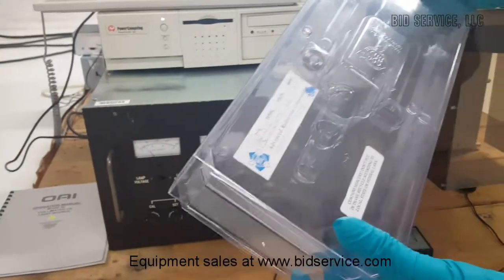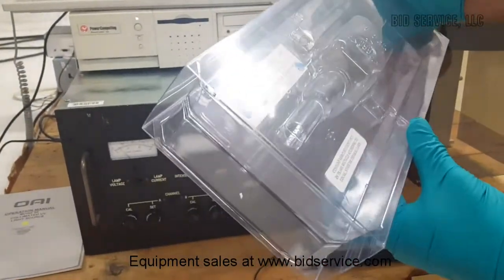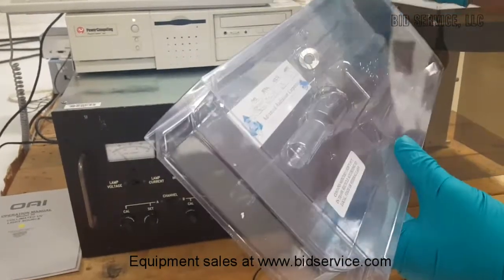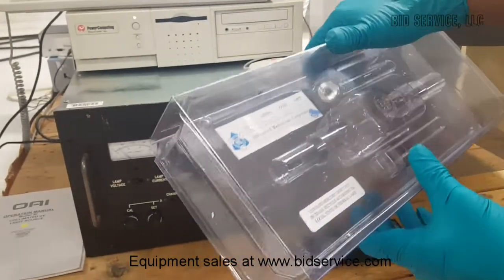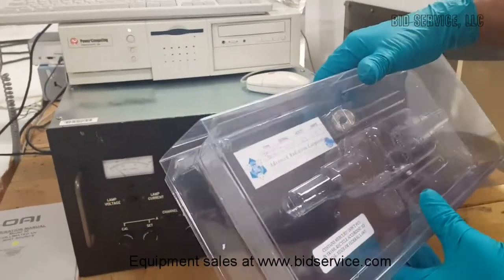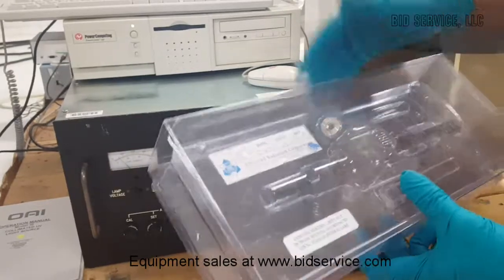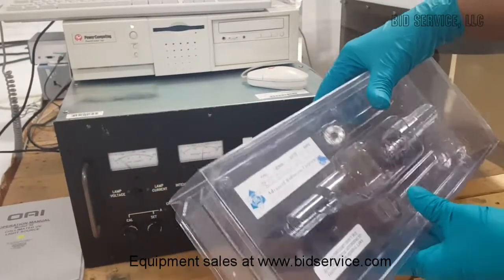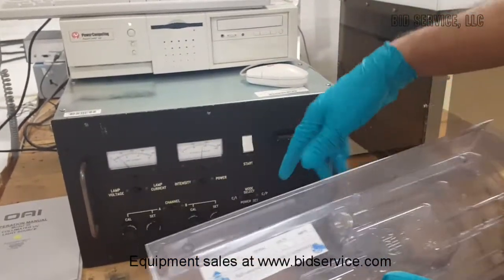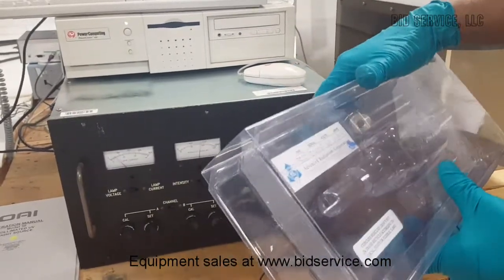This lamp has a limited life in hours as per the manufacturer, and once after usage, if the intensity levels seem to be dropping, then the lamp needs to be replaced.